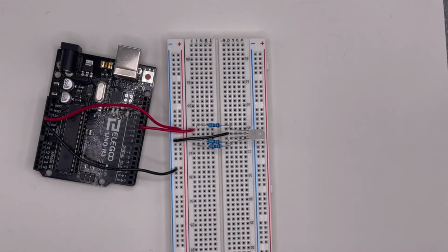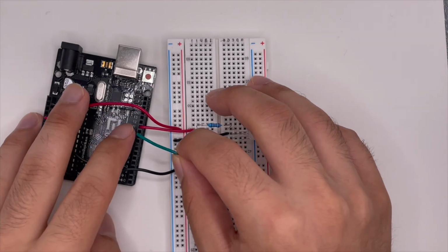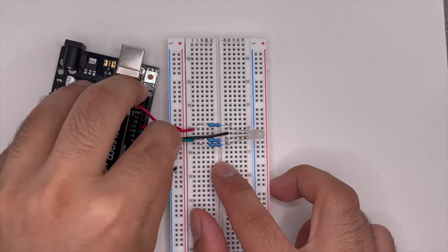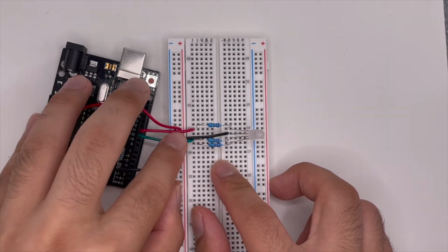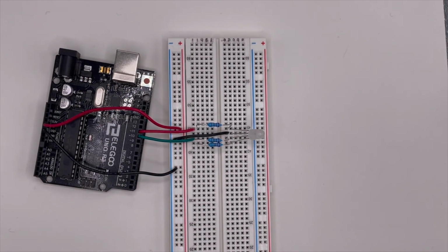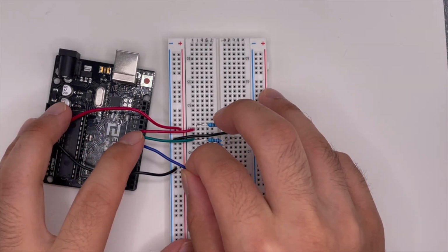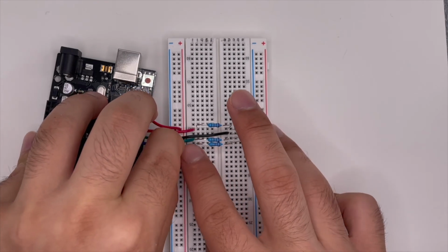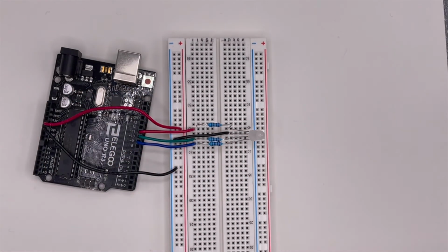Next up we have the green pin. We will be using pin number 10 on the Arduino, and we'll be skipping the ground wire and coming to the next one. Okay, and after that we have the blue wire. So we go from pin 9 to, again, just the last one here. And that's it. So the LED is now connected, and we can now connect the temperature sensor.